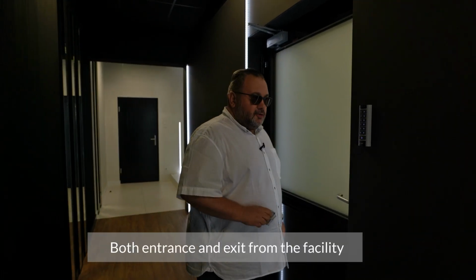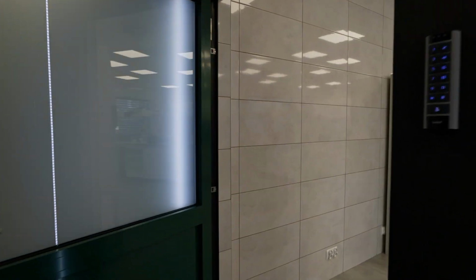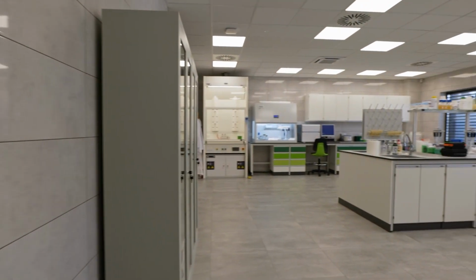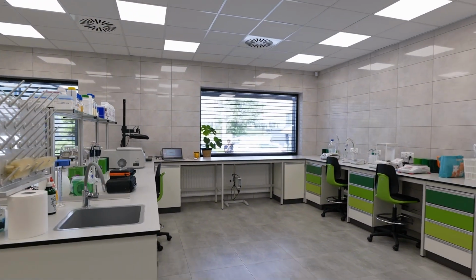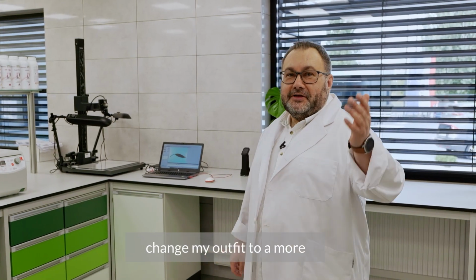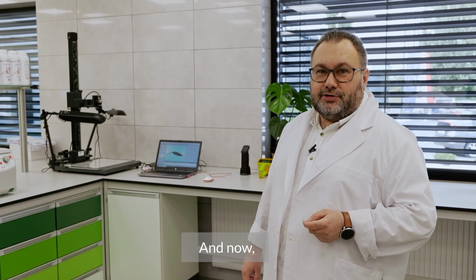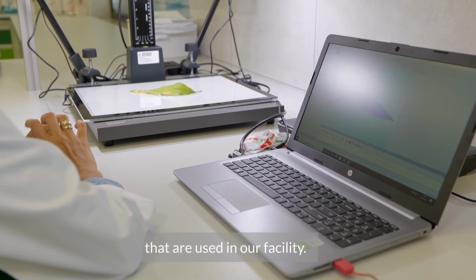Please step inside. Both entrance and exit from the facility are closely monitored, of course. As you can see, I used this opportunity to change my outfit to a more appropriate one. And now, I think we could discuss a few details and a few techniques that are used in our facility.